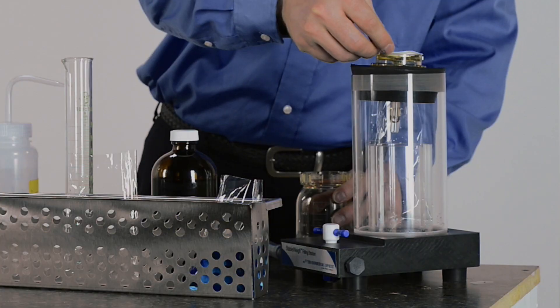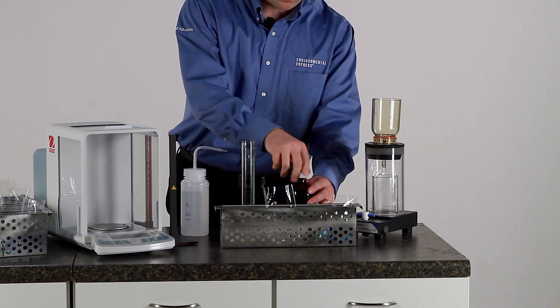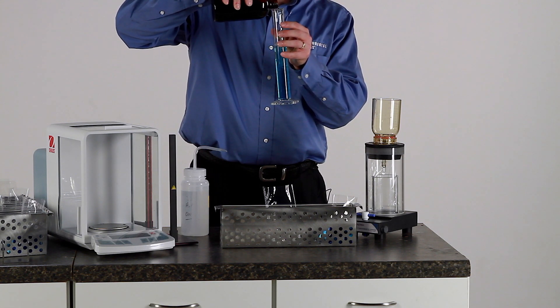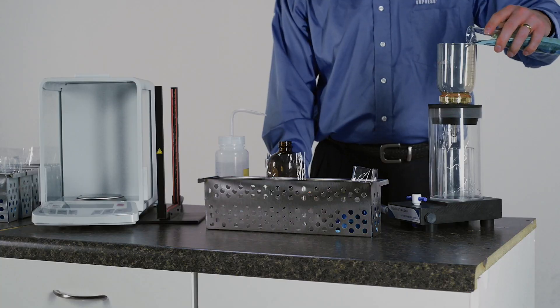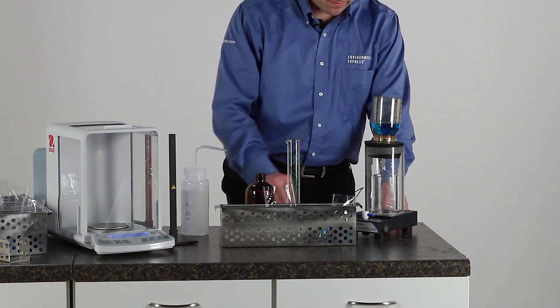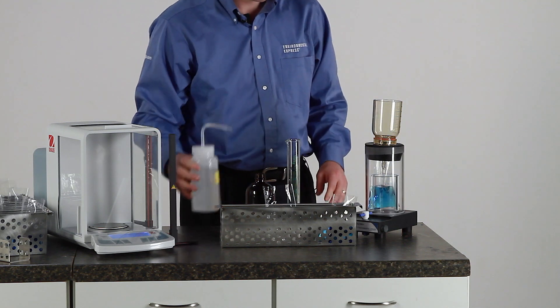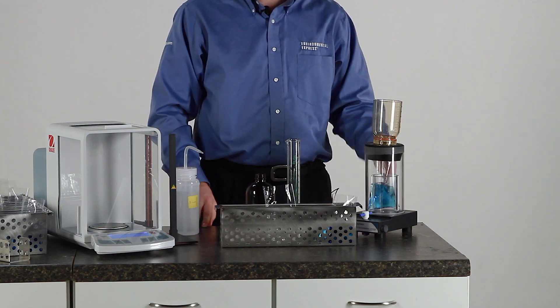Remove the top of the filter funnel and place your washed and dried filter on top, then replace the filter funnel. Measure out the sample that you are going to use. The vessel will hold up to 300 milliliters of sample, which will also incorporate the washings that you need for the filter funnel. We are going to do just 100 milliliters for right now. Pour your sample in the top of the filter funnel and turn on your vacuum. Rinse the sides of the filter funnel to ensure complete transfer of all samples from the filter funnel through the filter into the vessel.